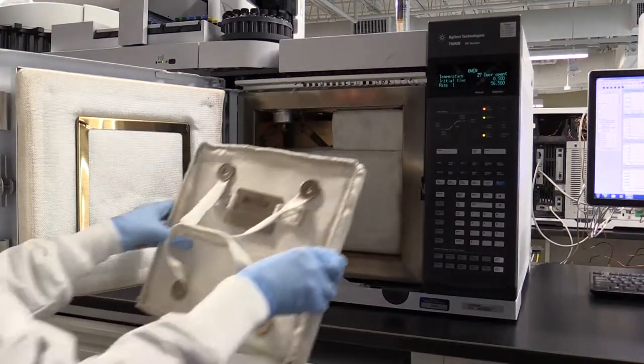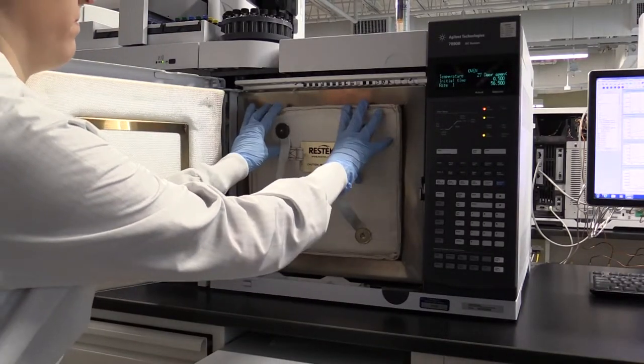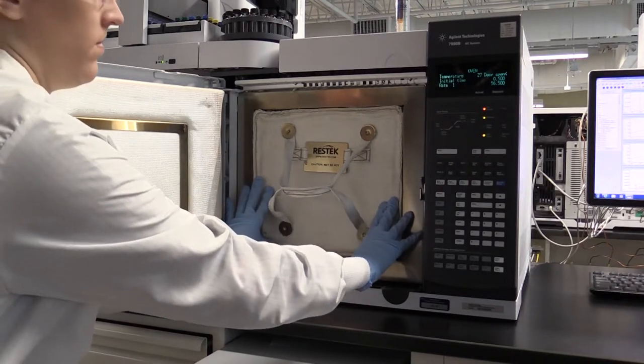Finally, install the plate insert in the front of the oven so that the front is flush with the edge of the oven.